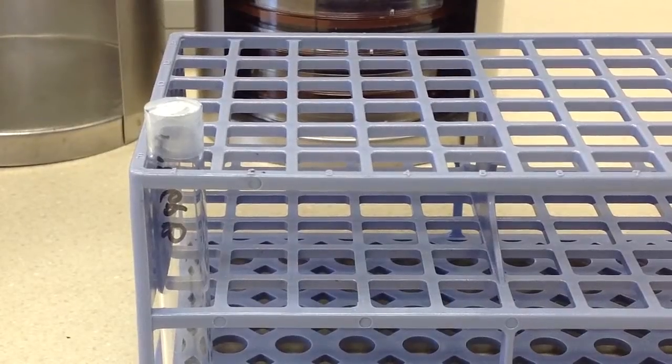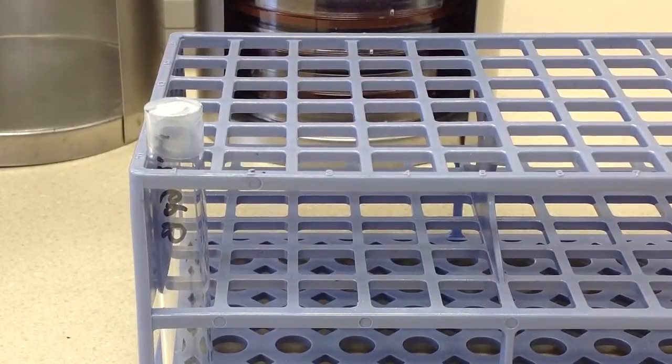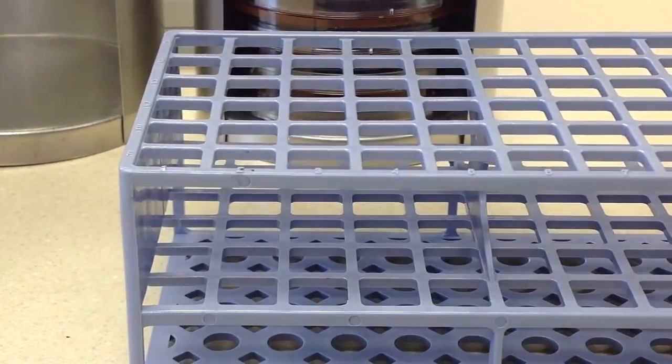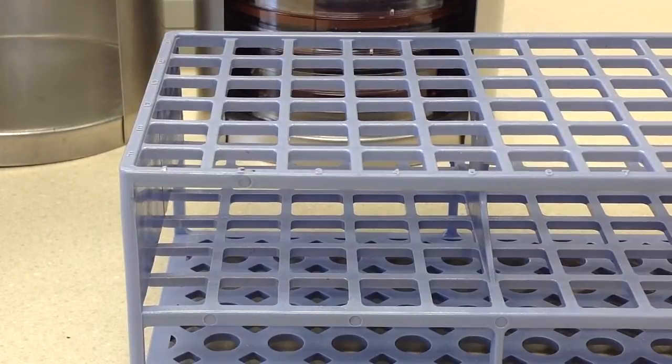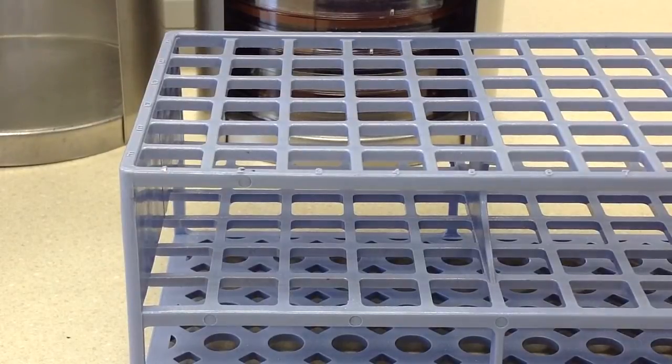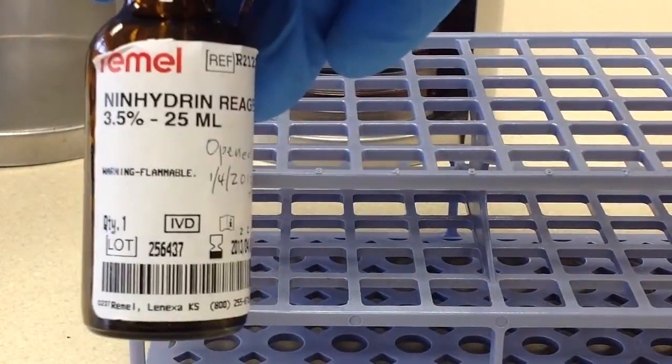The next step in our Hippurate test is to add two drops of ninhydrin reagent, and this is the reagent I'll be using.